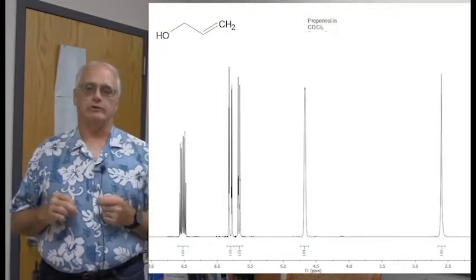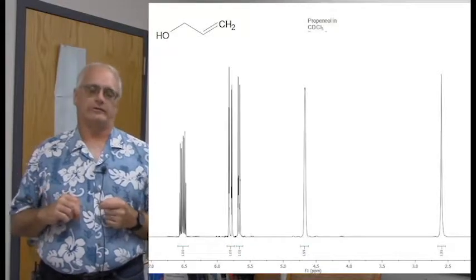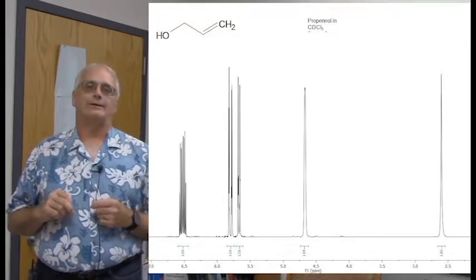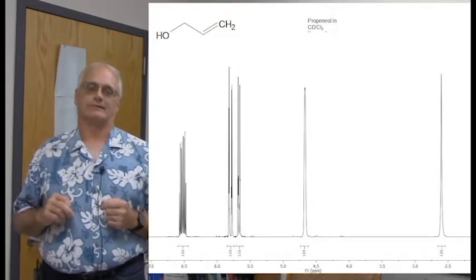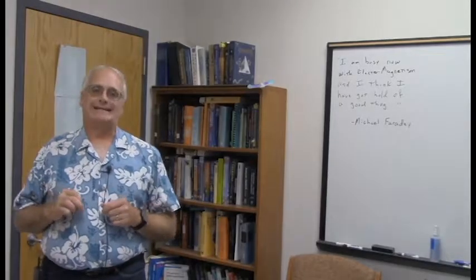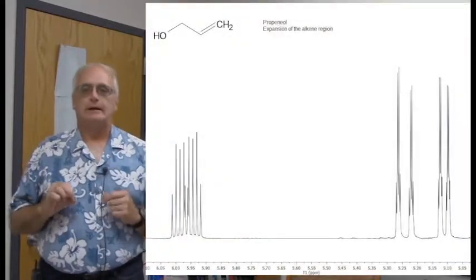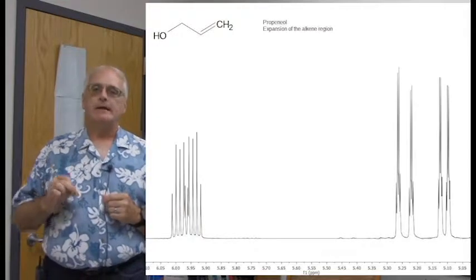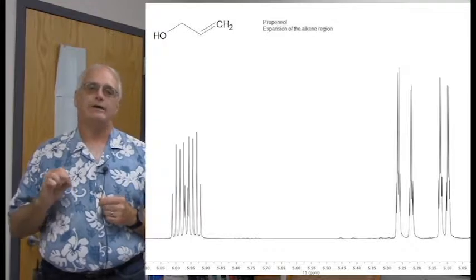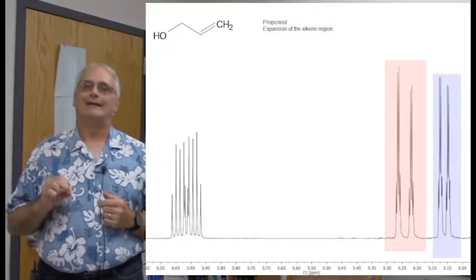We see the CH2 group right next to the alcohol down here, a little over 4.5. It's got the oxygen on one side, it has the alkene on the other, and of course we see the 3 alkene protons showing all their glorious, lovely, interesting coupling patterns. If we focus in on the alkene protons for a moment, we see the beautiful patterns that we expect to see here. And in particular, I want to focus on these two. These two over here are the trans and the cis protons. These are the protons of the terminal alkene.